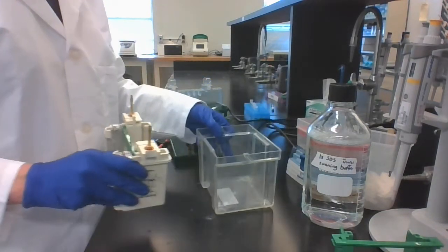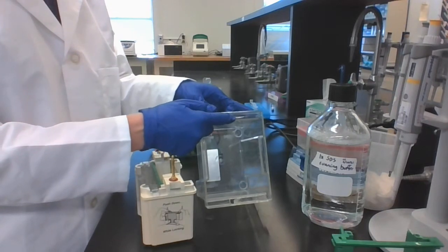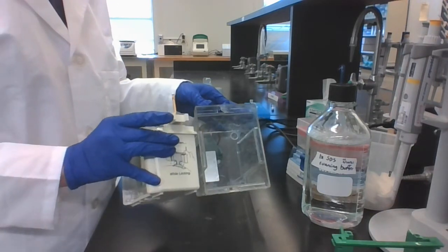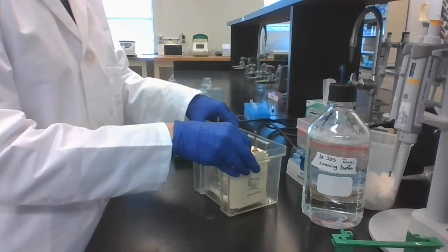Next step is to put it into the gel tank. The gel tank has these little knobs on it that will fit these parts right next to the electrode. It goes straight in there.